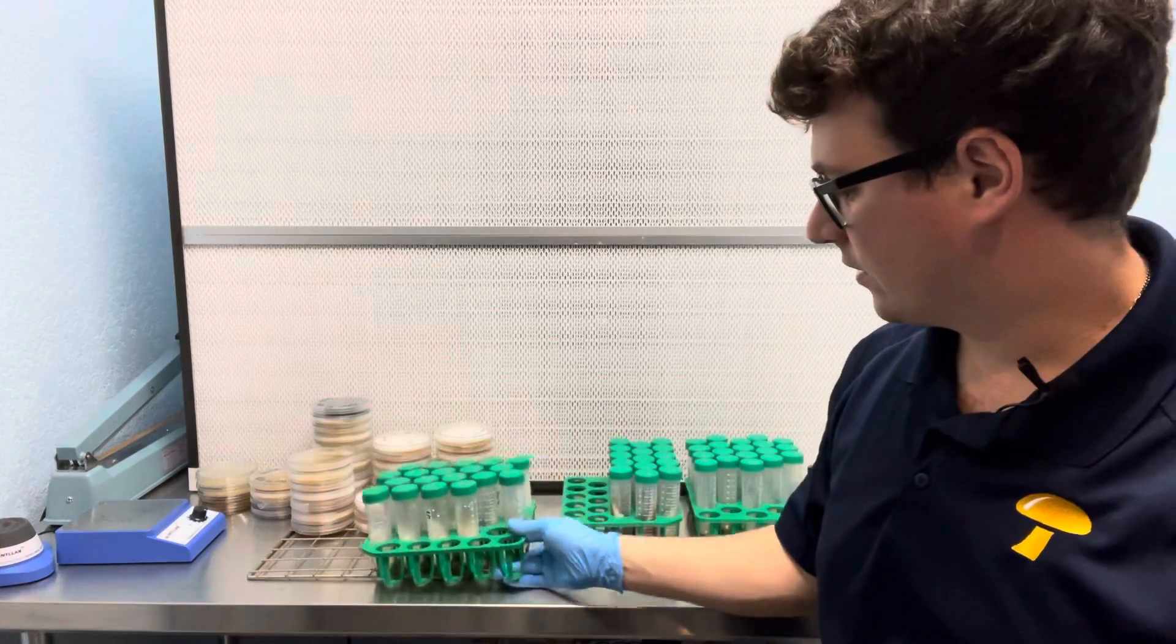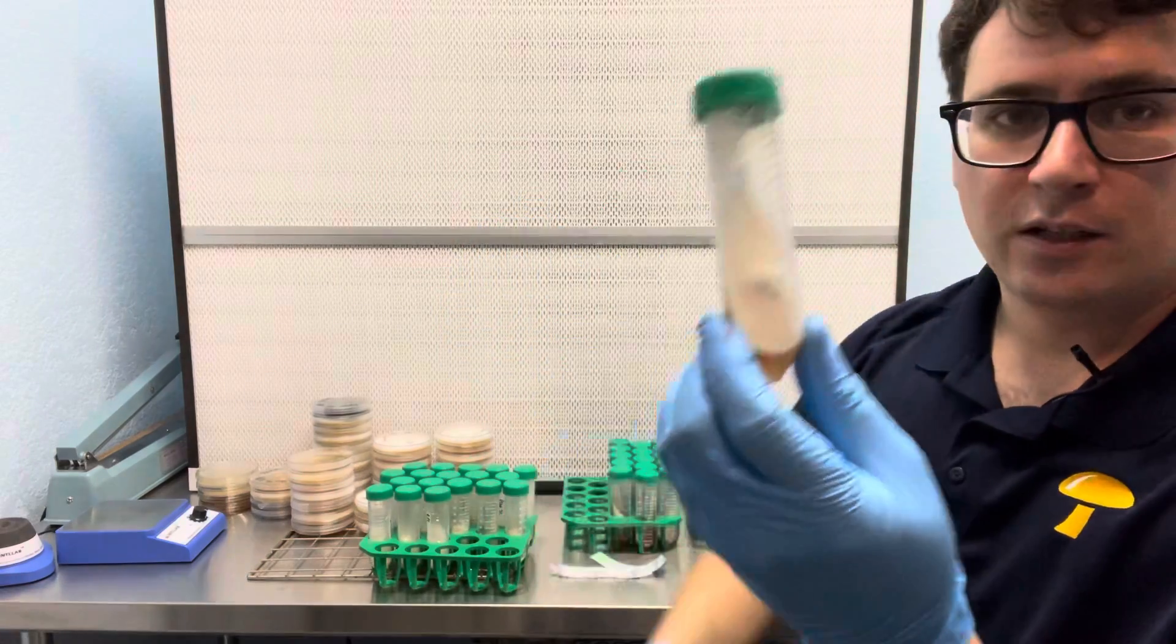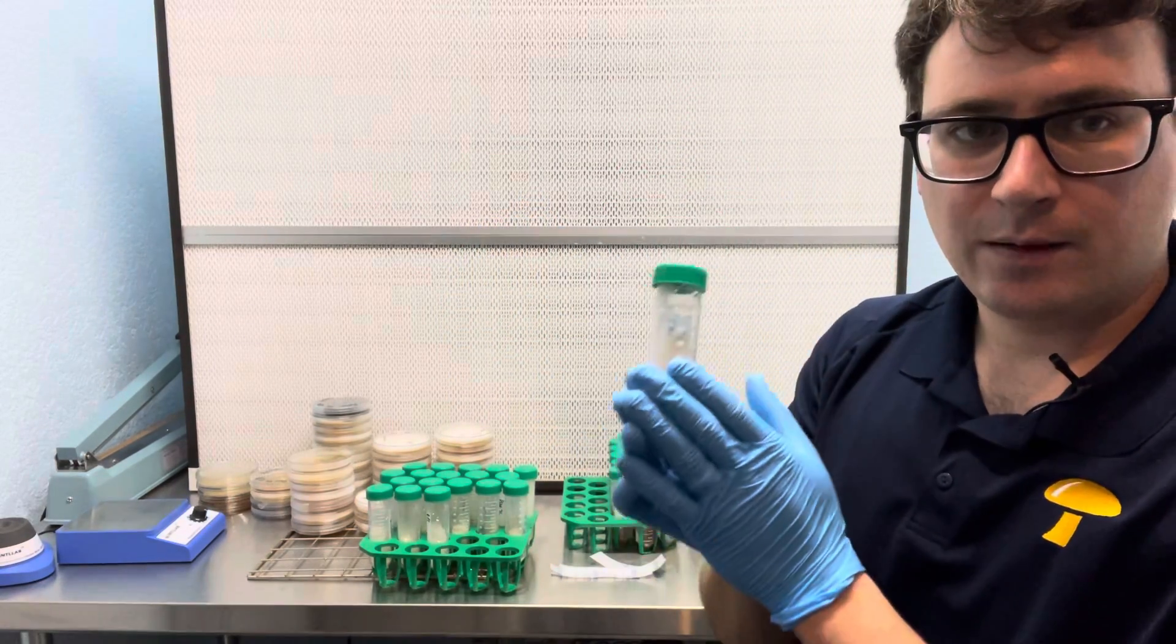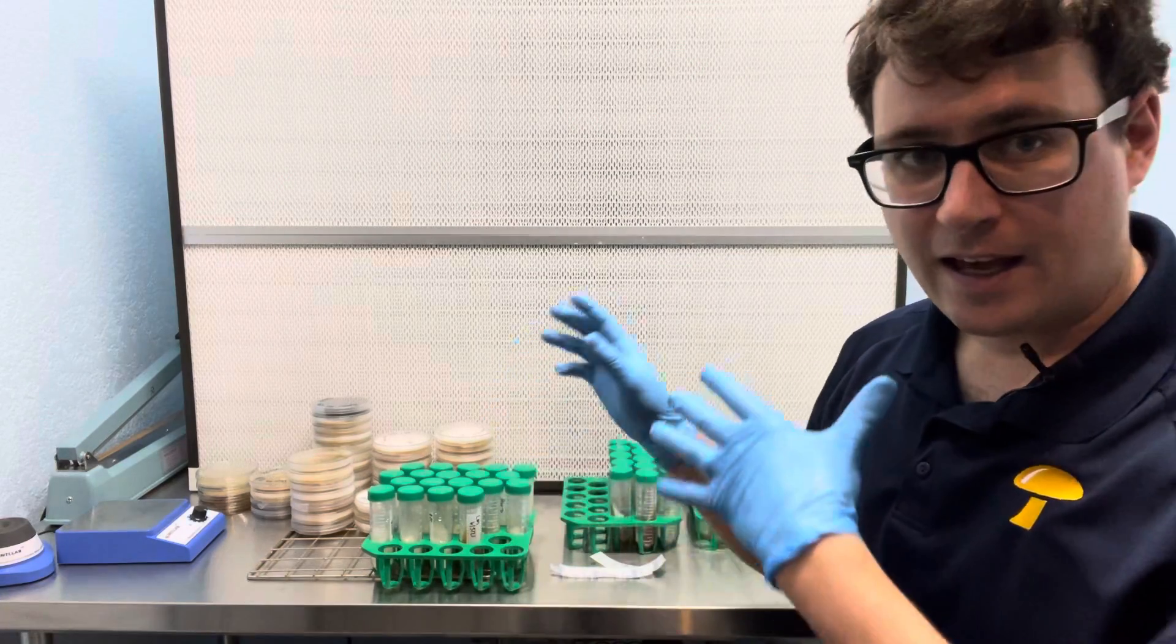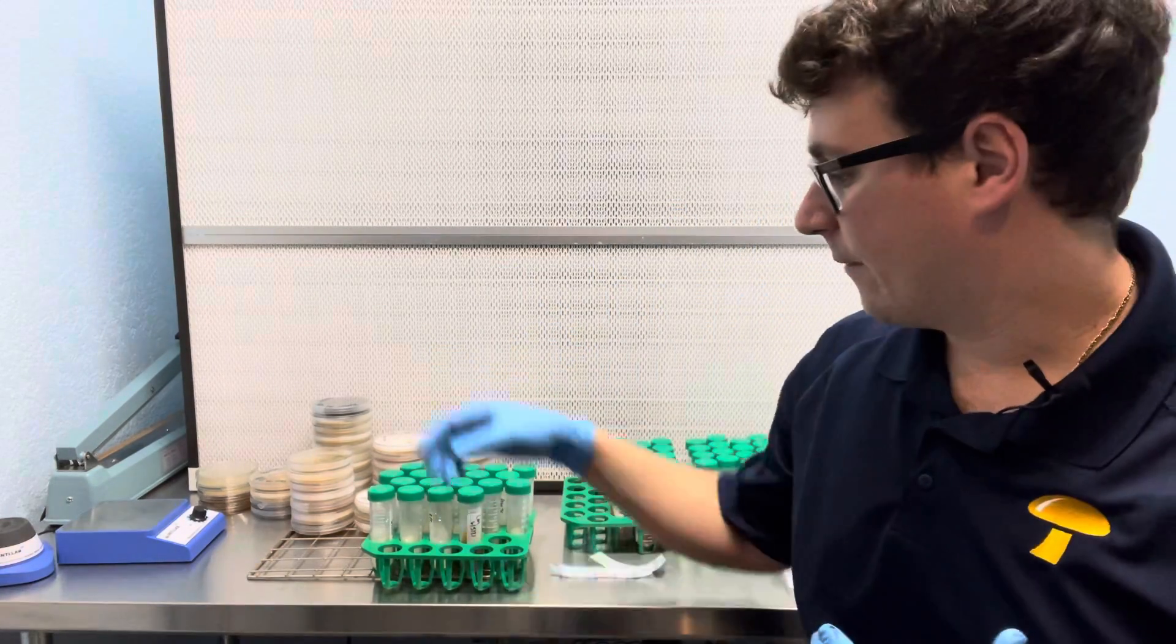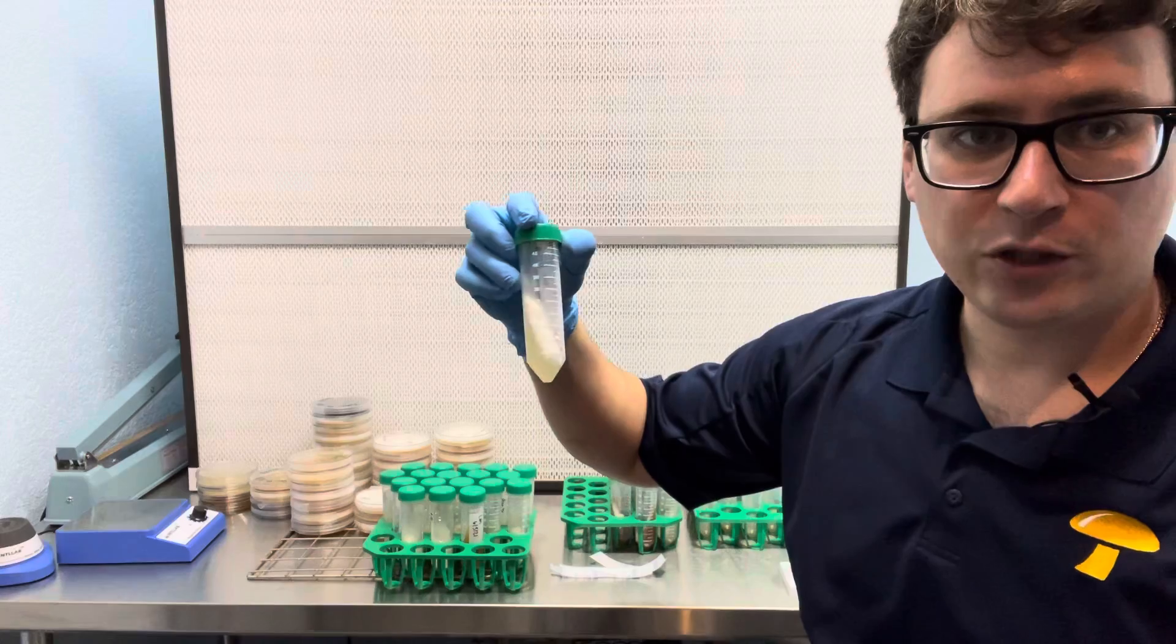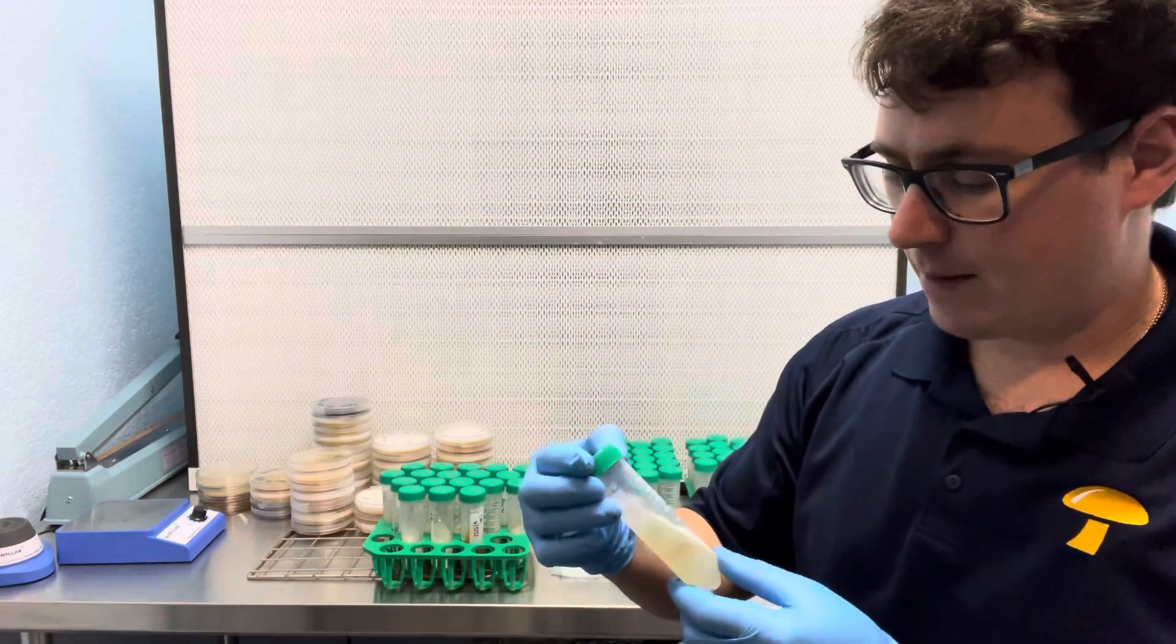So every six months or so I like to transfer my mycelium from my mother culture slants to fresh new slants and then I put them into long-term storage and that way I always have a backup culture of all the strains that I'm working with.